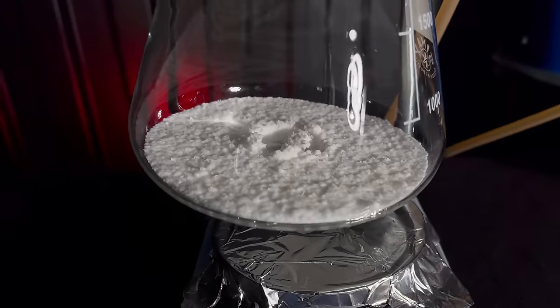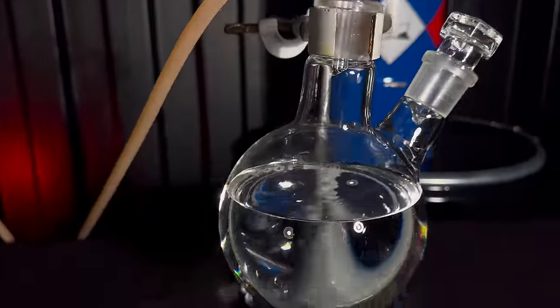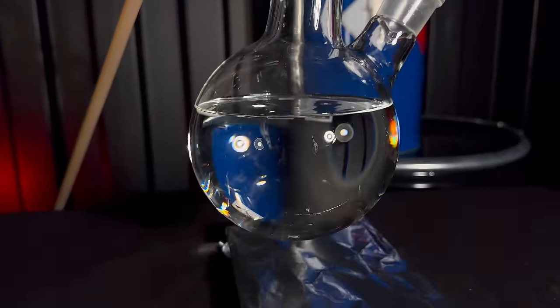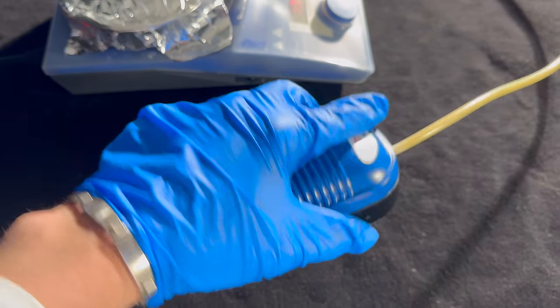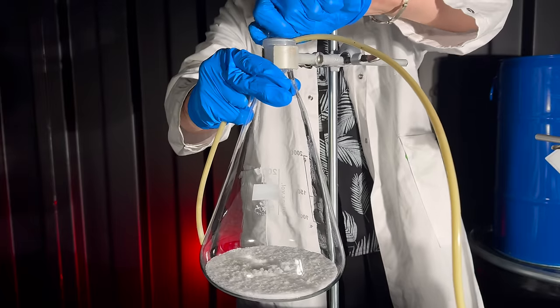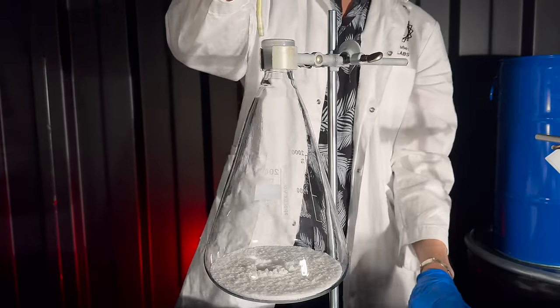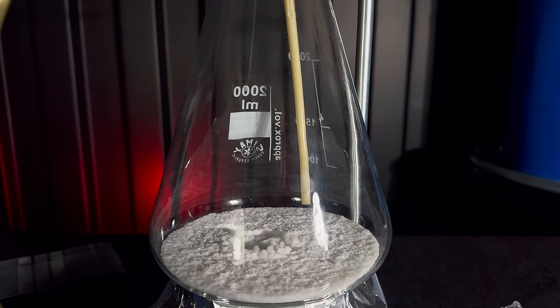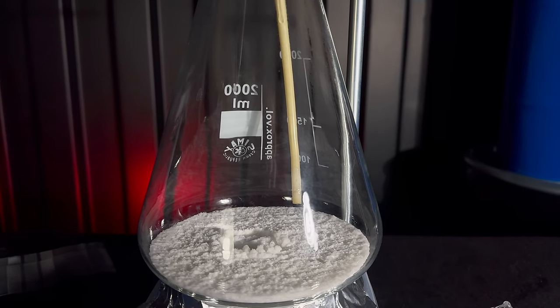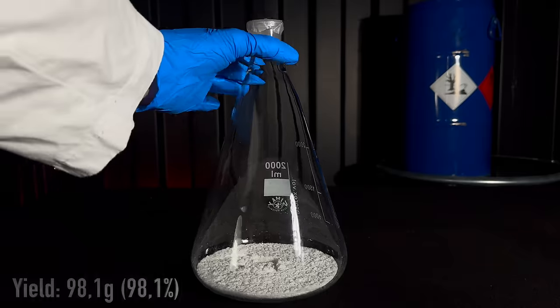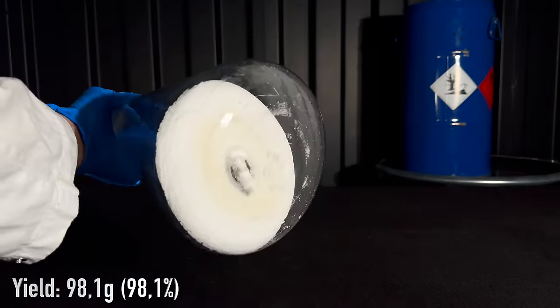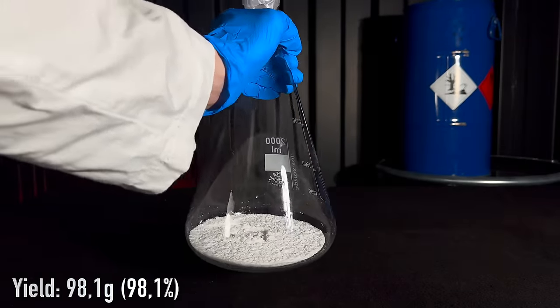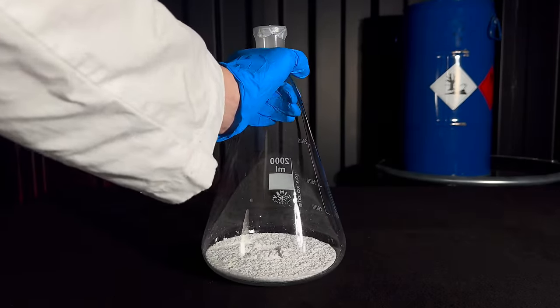This white rock contains a tiny amount of leftover acetone. It would not matter for further processing, but if I want to determine the yield, it needs to be removed. I used an aquarium pump and blasted atmospheric gas onto it at 80 degrees Celsius. Three hours later, the smell of acetone had completely disappeared. In the end, I got 98.1 grams of product, which is also a 98.1% yield.